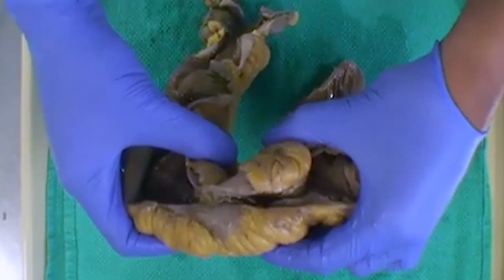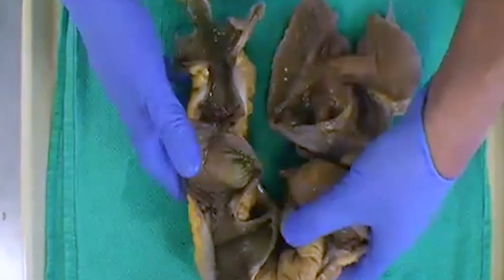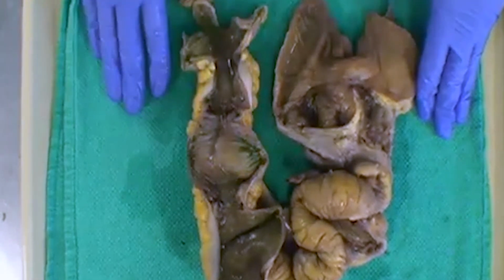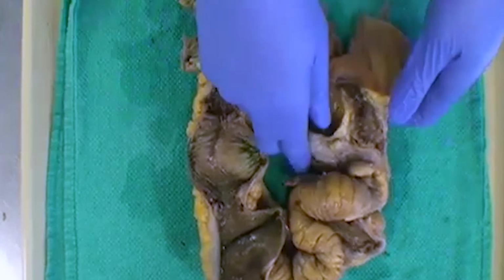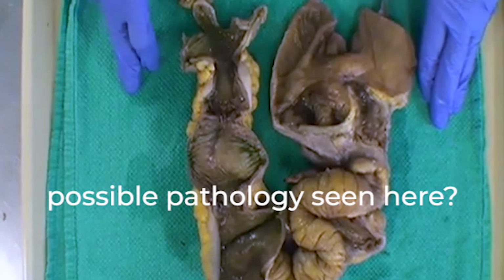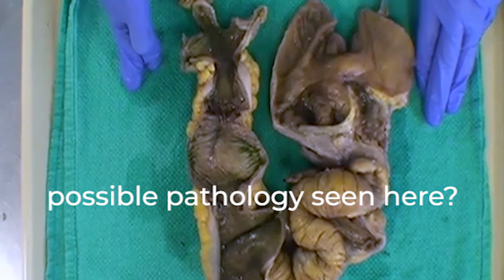And you can see it's quite narrowed in that area. So we sort of have an ileocolic resection, and we seem to have some patchy stricturing or thickening of the small bowel, and the large bowel looks relatively preserved. No mass lesions or anything like that. So does anyone have any thoughts on what the diagnosis may be in this?